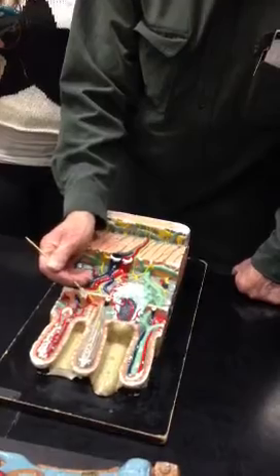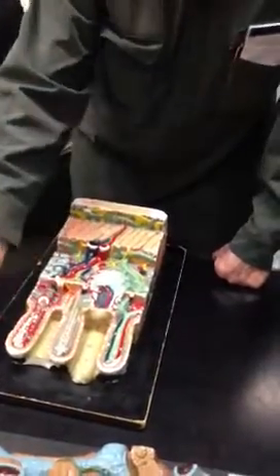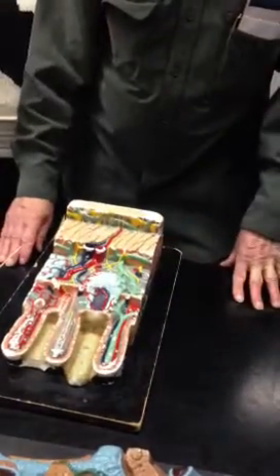So you've got the Paneth protective cells, you've got the actively mitosing cells, they march up, they fall off. All right, so that's that setup.